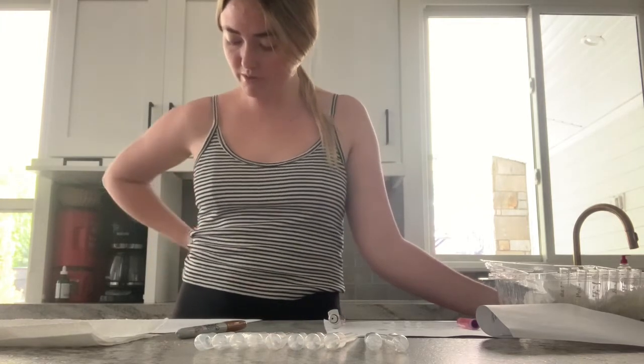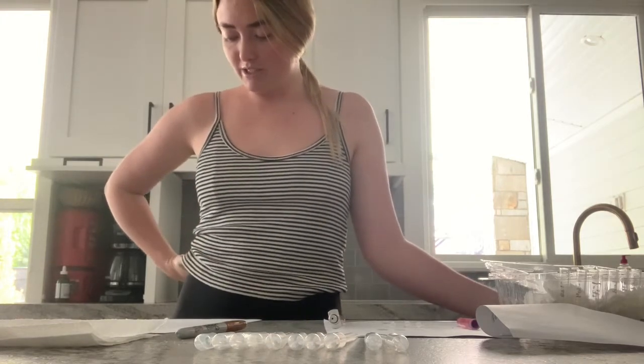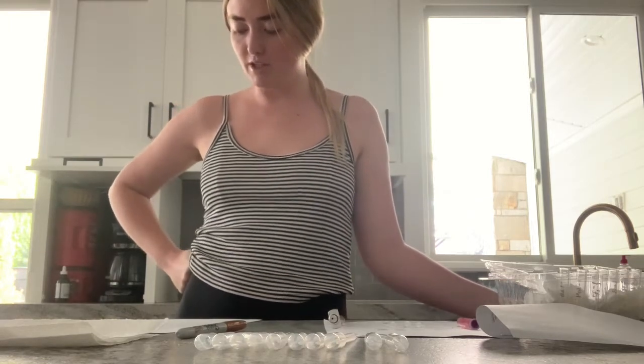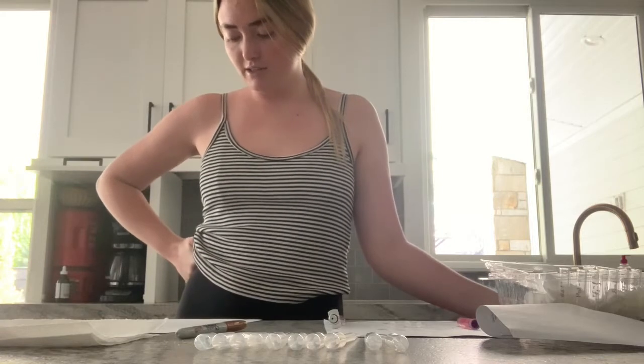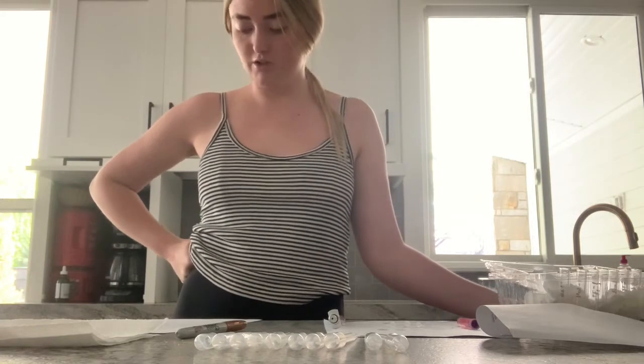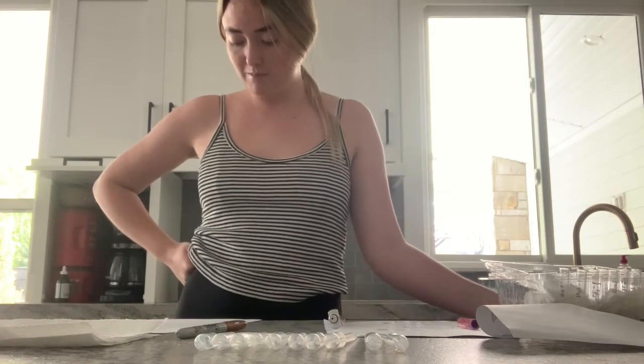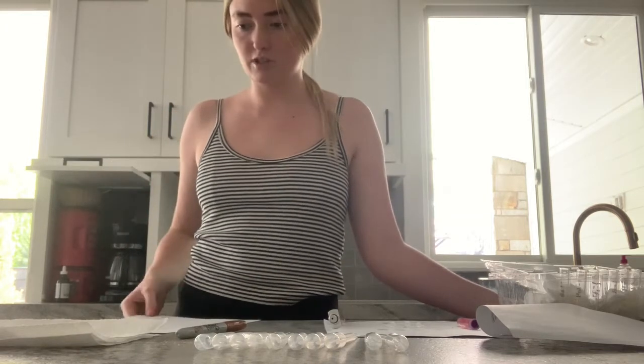We can make connections to titrations in this experiment because the K-check tablets work as an indicator by telling us how much of the sample is able to react, which also tells us the concentration, because we can figure out how much ketone is present by how far the sample must be diluted in a series of serial dilutions.